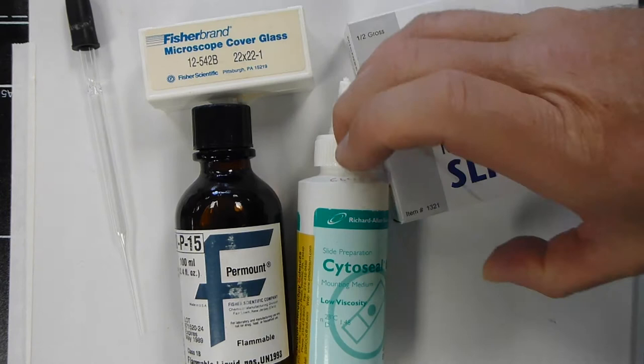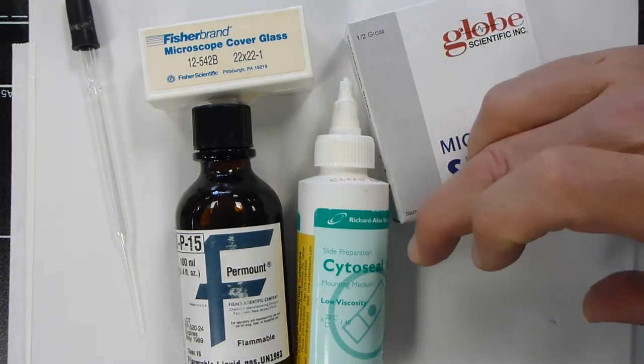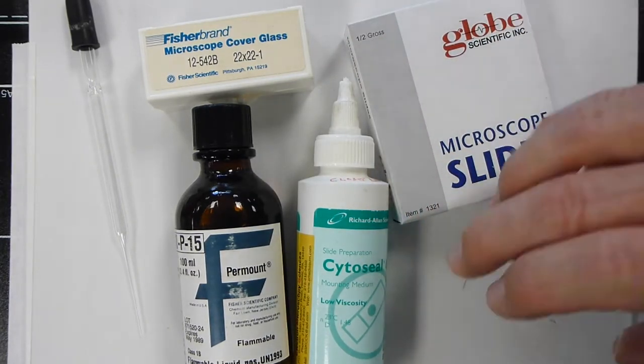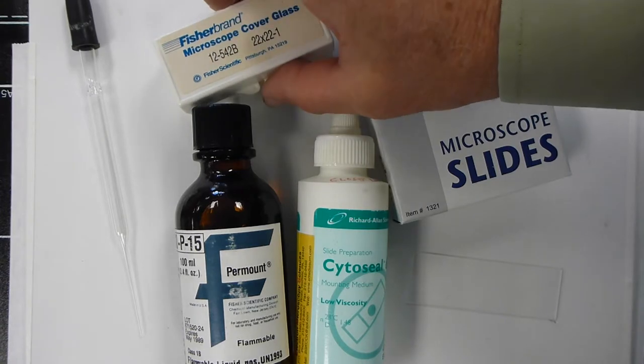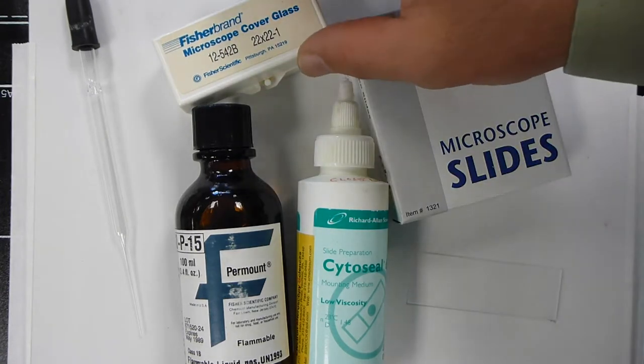You need a microscope slide that you'll usually find in a box, you'll need some cover glasses, either round or square, but use glass ones.